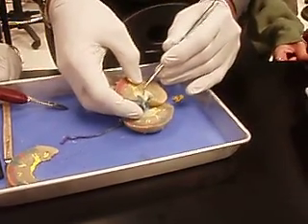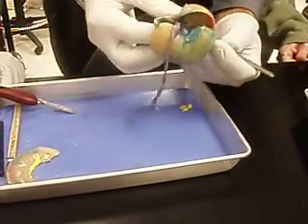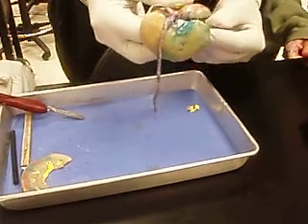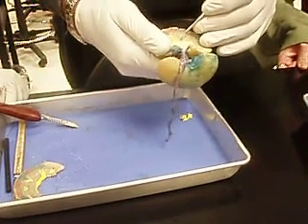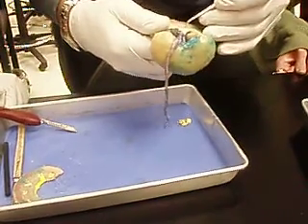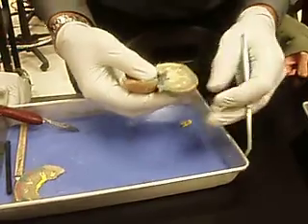As we track this down, you should be able to see this heading out to the ureter. The pelvis into the ureter. And also through the major calyx. So, somewhere along here is part of the pelvis. Where would you call it a major calyx? I don't know. On this one.